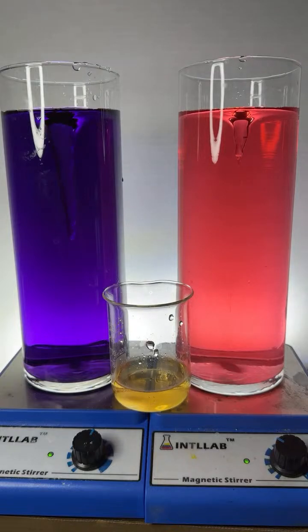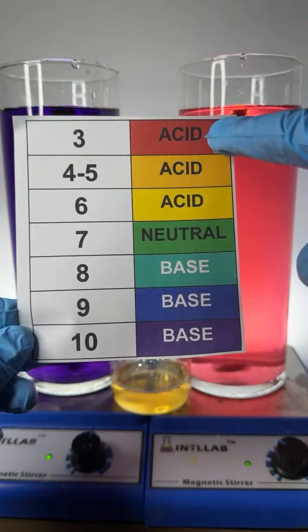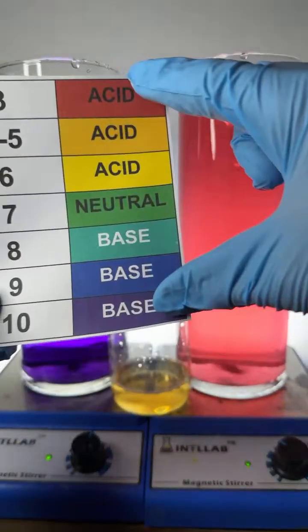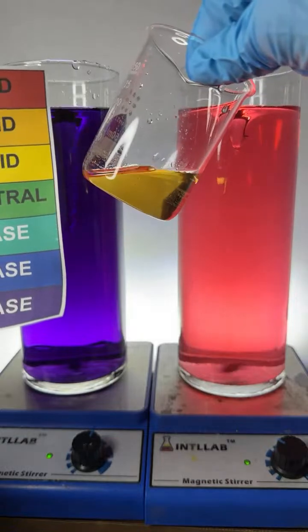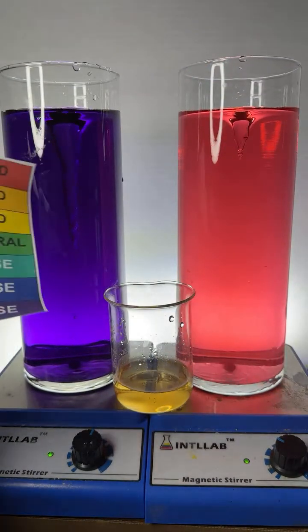The reason why it makes sense is because if you mix acids and bases together, you neutralize each other. So we have an acid over here at pH 3. We have a base over here at pH 10. And when you bring them together, they neutralize each other, so they both come closer to pH 7. It looks like we ended up with pH 6, and that's because this is a bit more acidic than this is basic over here.